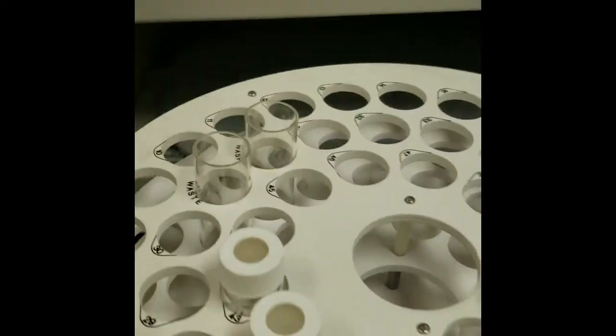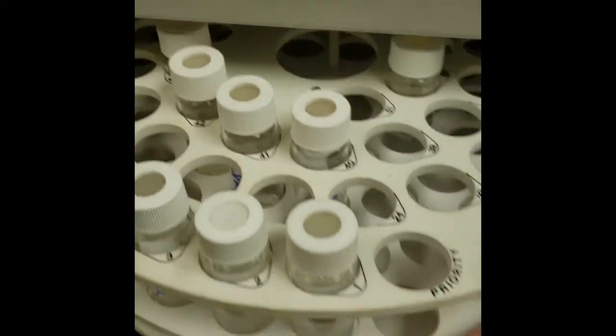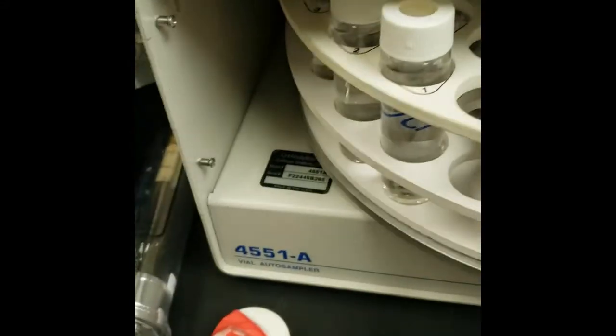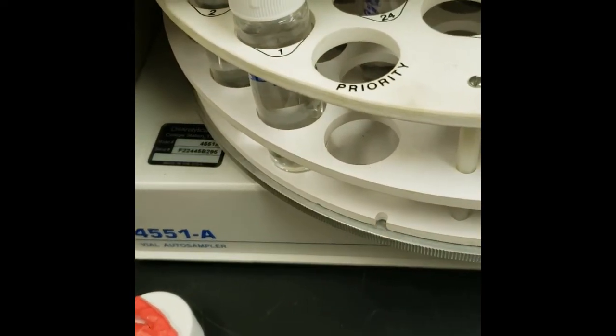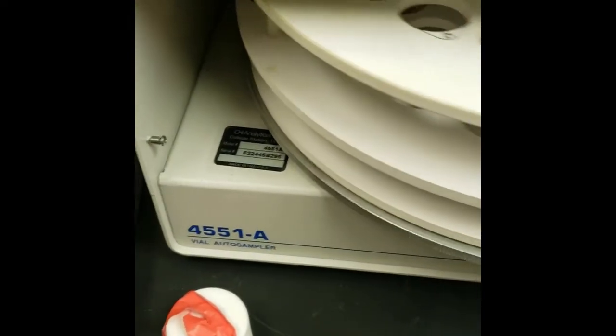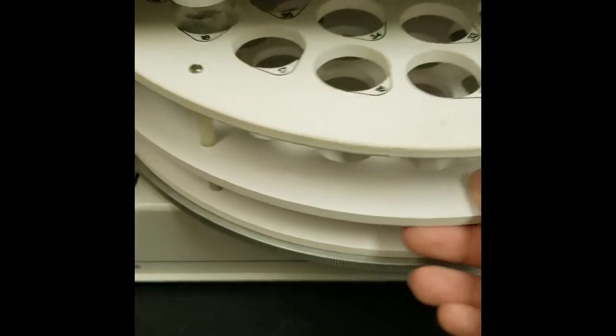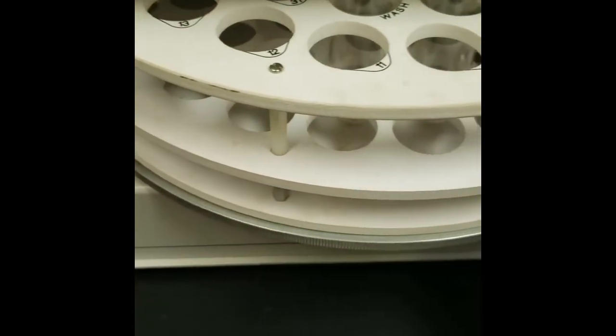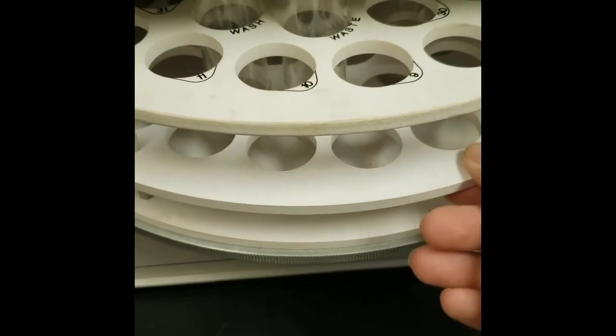the next run. So then you'll put your tray back, and you'll have to twist it around until you see that this notch here, there's a little metal piece that sticks up. Sometimes it's in the back, so just twist it until you feel it click in place here. There. So now it won't move at all.